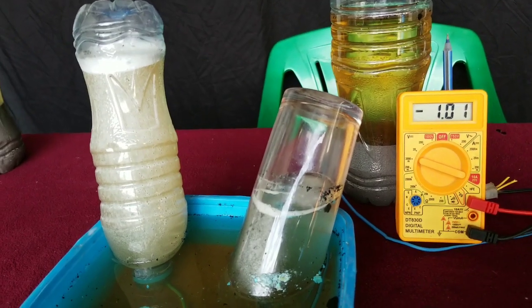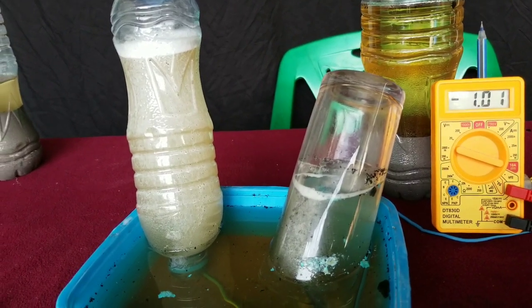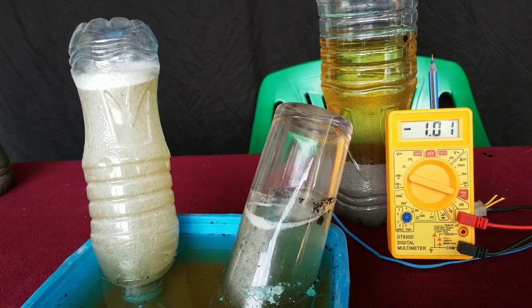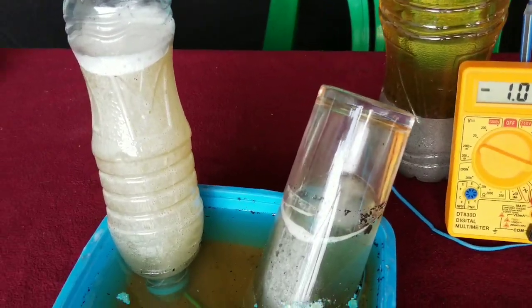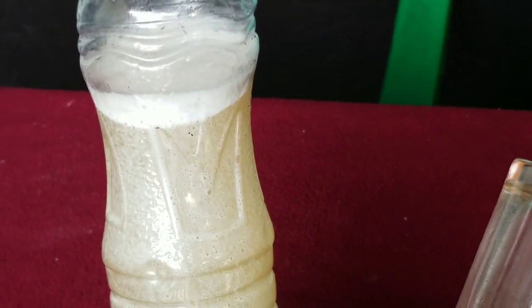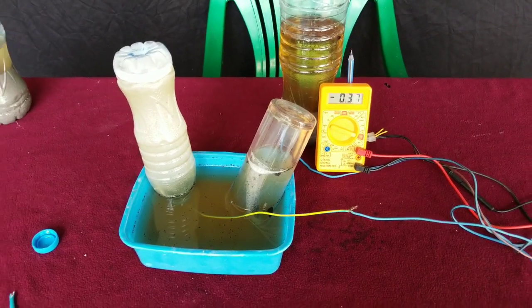So I decided to adjust and pull up the glass container in order to allow more electricity to pass through the solution. This improved the production of hydrogen gas at the negative electrode. You can see that now we're getting a lot of hydrogen gas being generated because of the adjustment we made on our experiment.